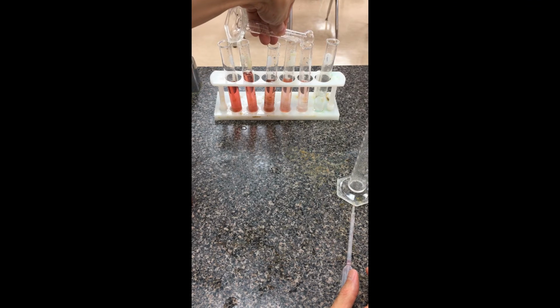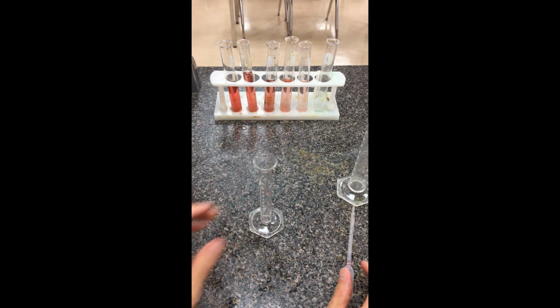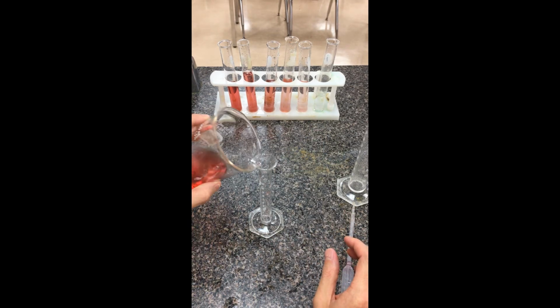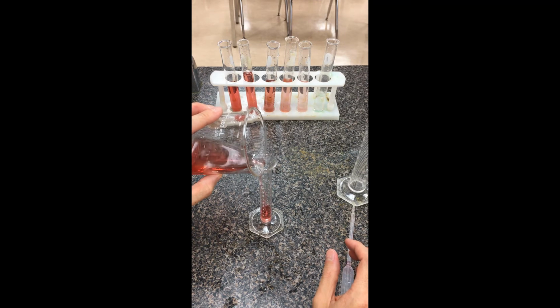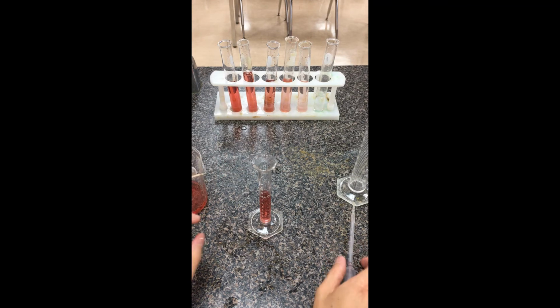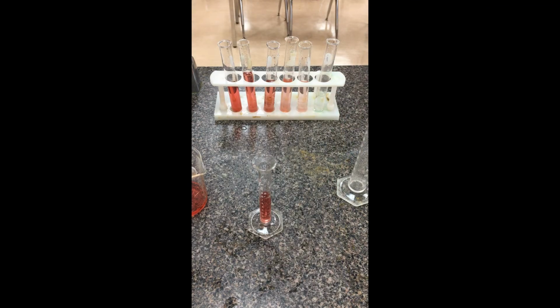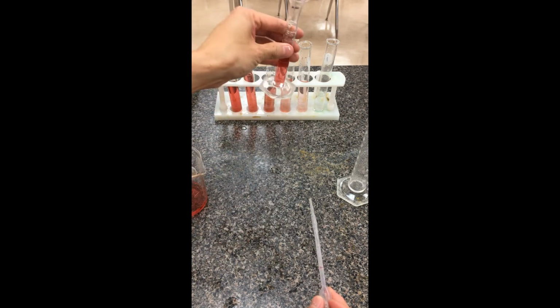Now normally for an unknown here, this may have been after you've done a reaction of some sort. I've just put in a random amount of water here. I'm just going to add up the difference. And then using our spectrometer, we're actually going to figure out what the concentration of this is. Okay. So just making a very qualitative observation here, you'll notice as we've steadily diluted it in more and more water, we see that the color intensity actually does drop.